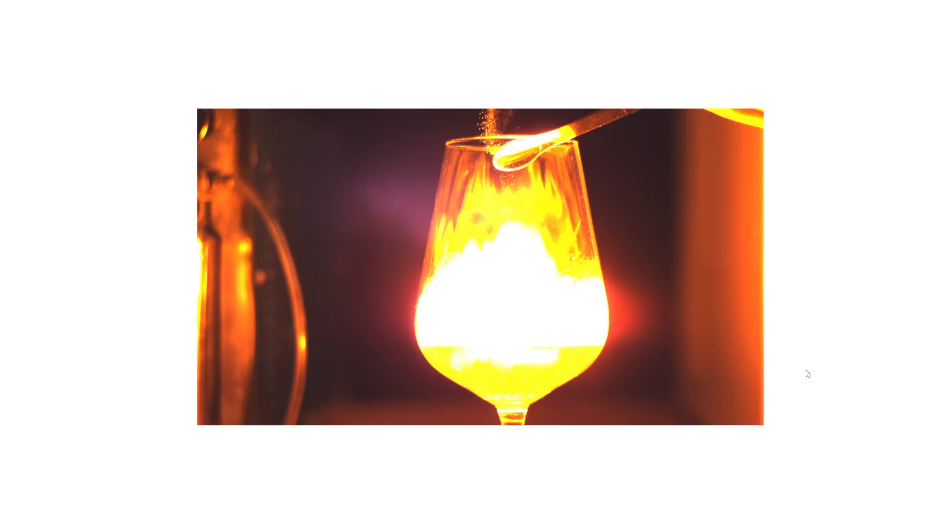The weird thing is hydrogen burns with an almost colorless flame, but it's quite a hot flame — about 3000 degrees Celsius, which is sort of typical flame temperatures — but that's enough that if you get little sodium particles in there you get the sodium emission, which is what you're looking at there.